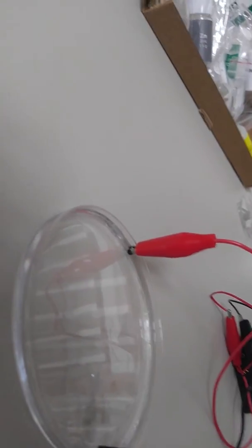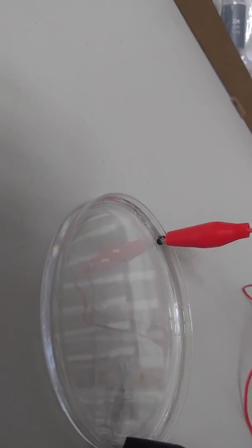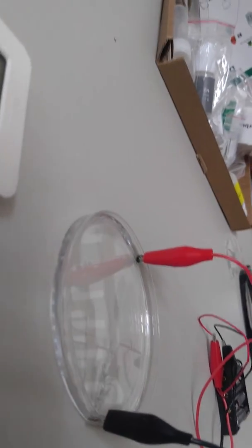That's so weird. Why does it do that? You can read about the explanation after the experiment's over. It's not touching the water, I can see. It's touching the water or it wouldn't be working. The current wouldn't flow if it wasn't touching the water. It's touching it just a little, but that's all it has to do.